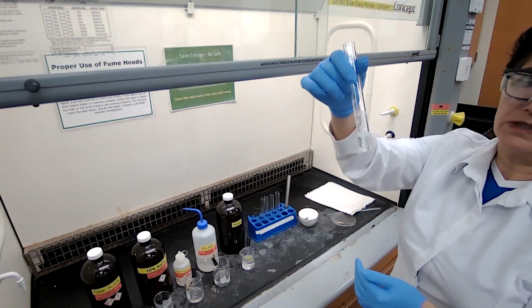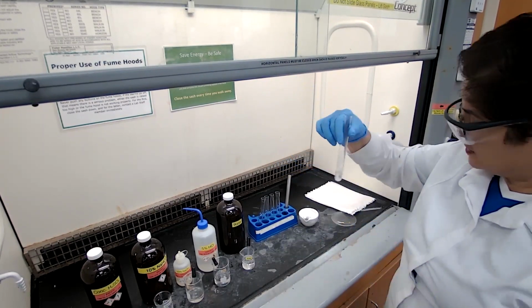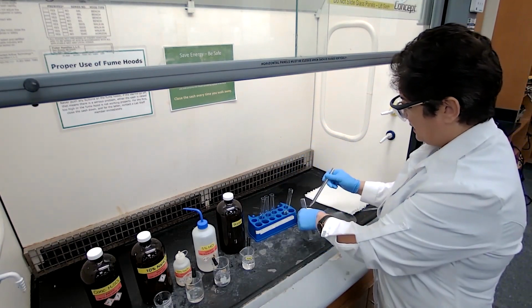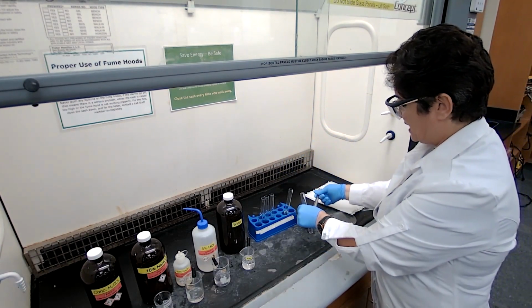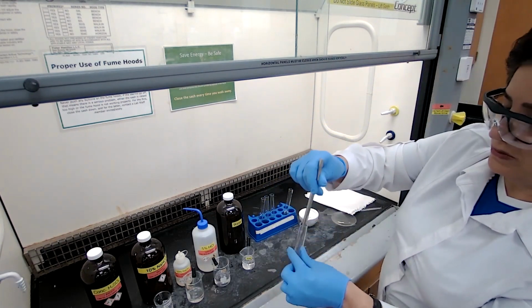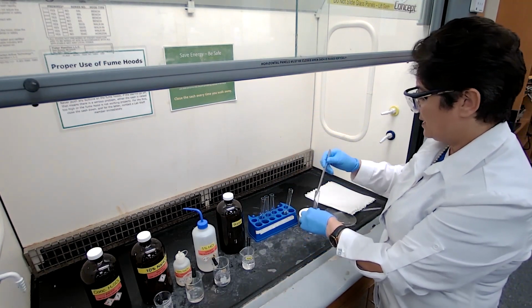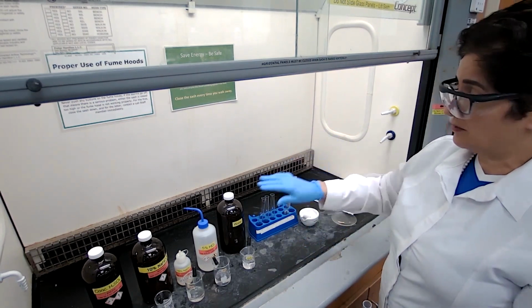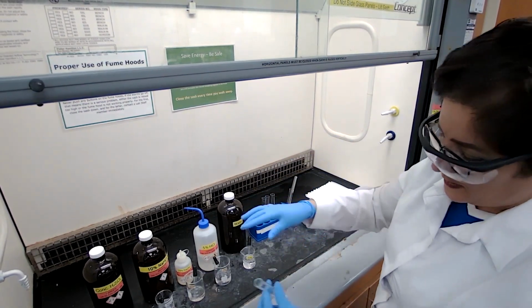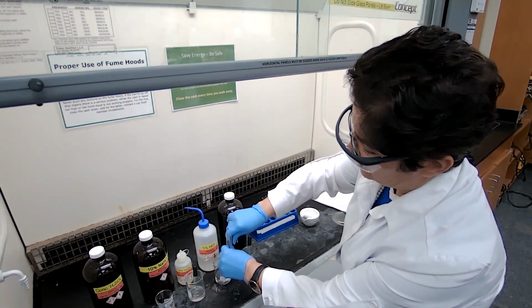We are going to continue to the next solvent. So unknown A did not dissolve in water. Now we're going to test solubility in HCl. Similar procedure to the last experiment, solubility in water. And I also want to remind you that because it did not dissolve in water, I don't have to test for pH. With the HCl, I add a tip of a spatula of the sample.